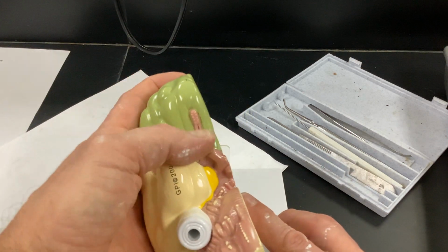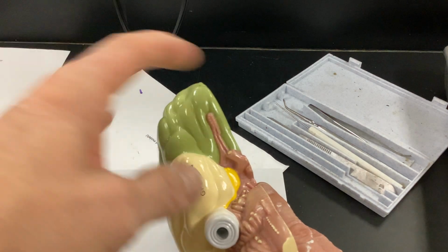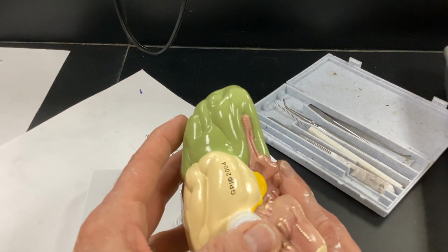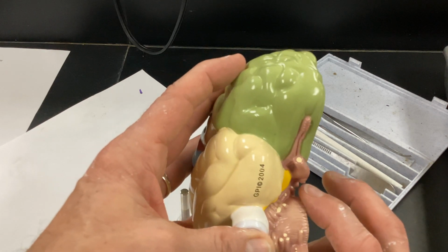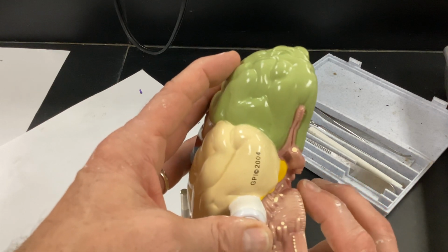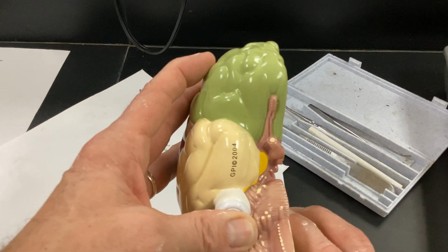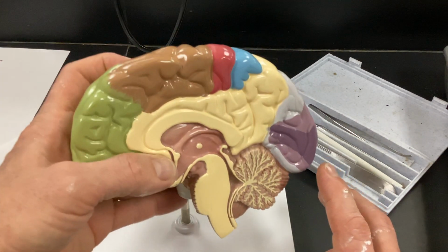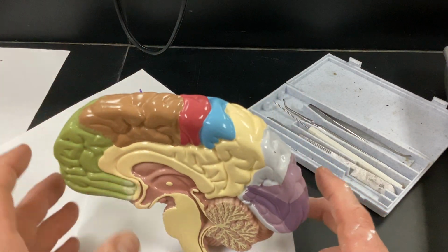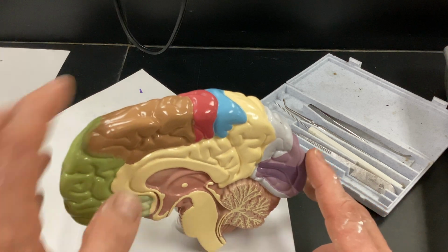There's your cranial nerve 1, olfactory. There's cranial nerve 2, sensory for seeing. The optic chiasm should be there. You can go through the cranial nerves, look at pictures of them. They're going to come off of the pons, the brainstem. All right. Remember what the exception was that drops down? Remember vagus? So those are some of your cranial nerves.